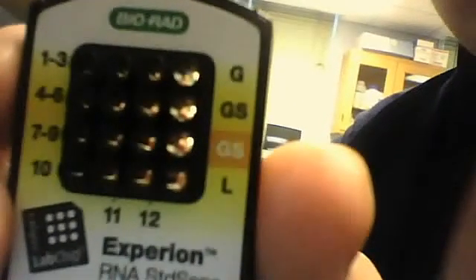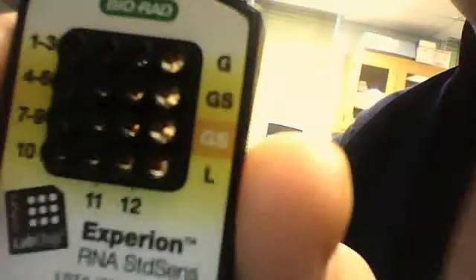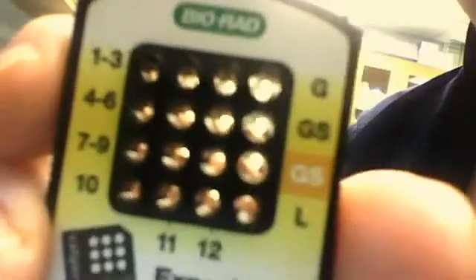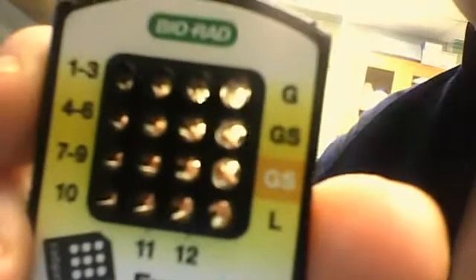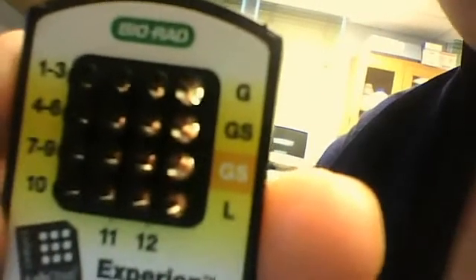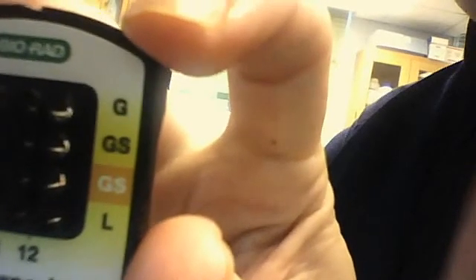But during the time that you're doing that process, you want to be loading this chip. You want to load, you've already loaded your GS well, so you want to go back to the other well that says GS, which is above the one with the orange block around it, the one that's labeled GS in black. You want to load that with nine microliters of stained gel. And then above that, which is the G, the G circle well, you want to load nine microliters of unstained gel, just the filtered gel into that.